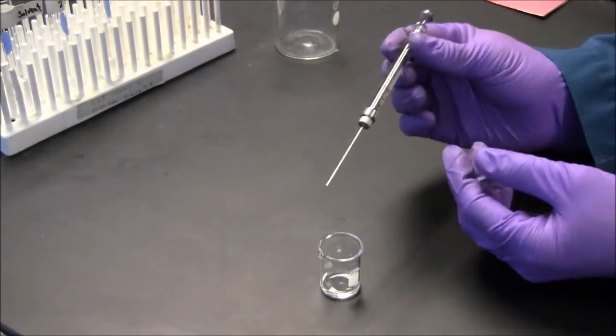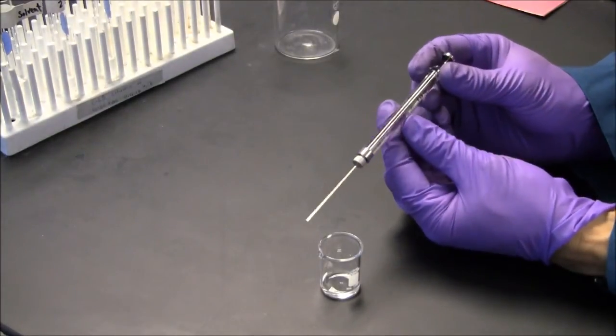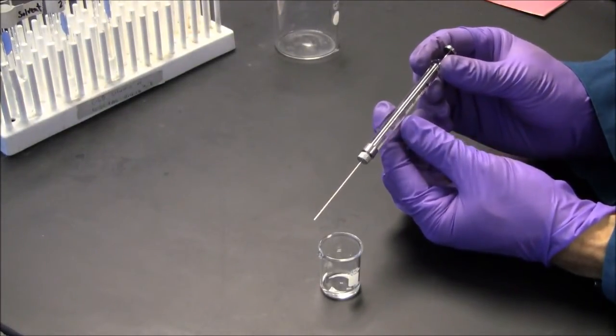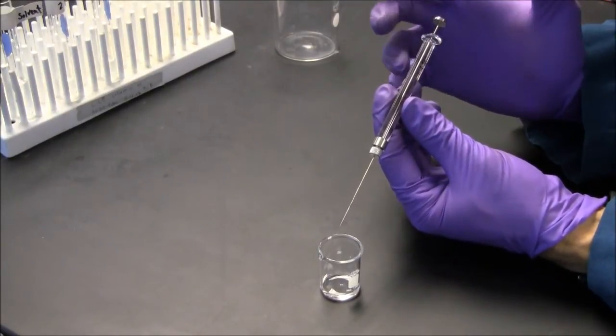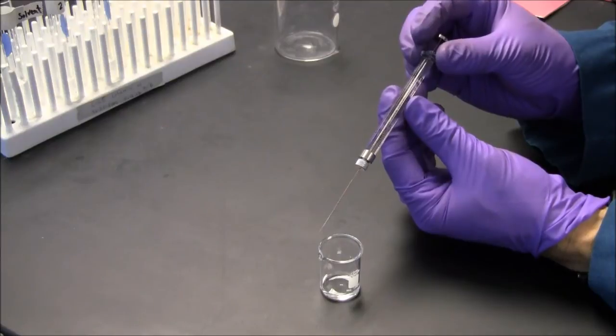The syringe will work well with any solvent, but I will recommend that you use this when you're pipetting organic solvents that you can't use a micropipetter accurately.